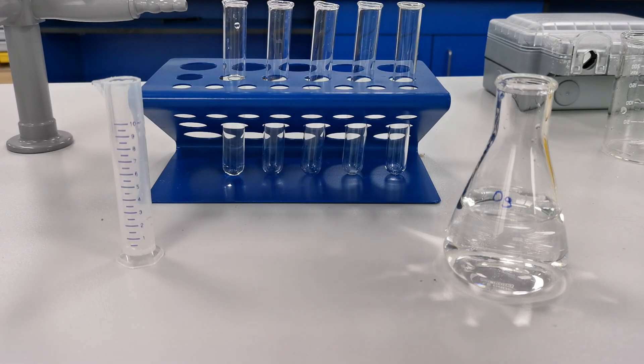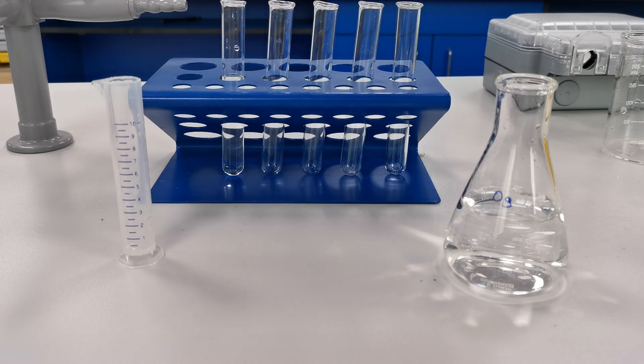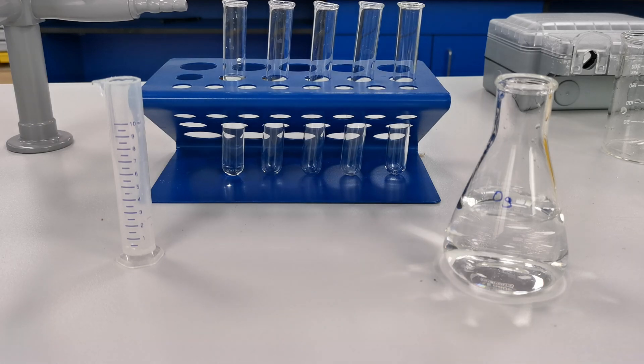And I'm going to continue until we have zero molar, 0.25 molar, 0.5 molar, 0.75 molar and one molar sucrose solutions.